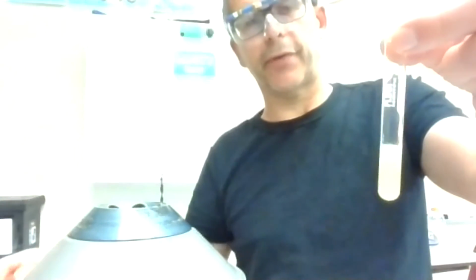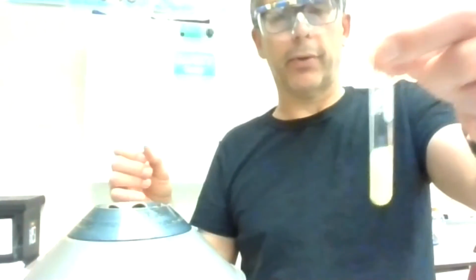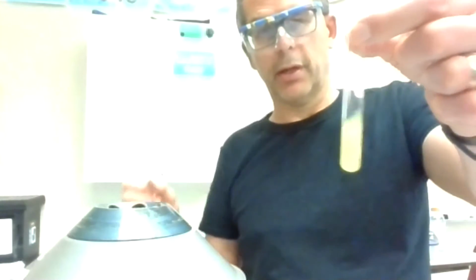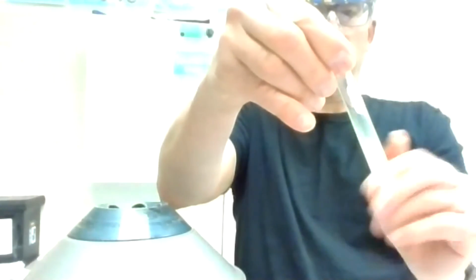Okay, again, I could centrifuge and spin that around, but I don't think I need to do that, and it's pretty distinctly cloudy in this last step. Just give it a little mix and work with that. So that is unknown D.